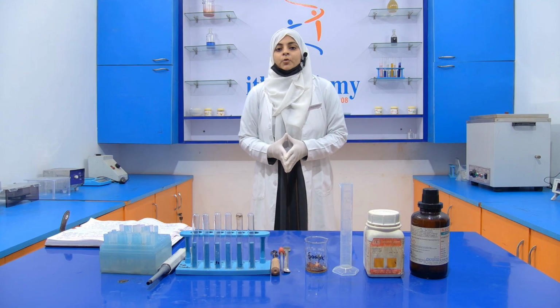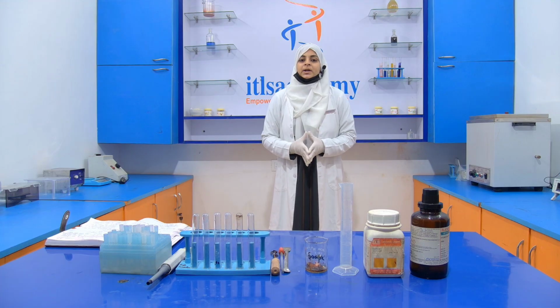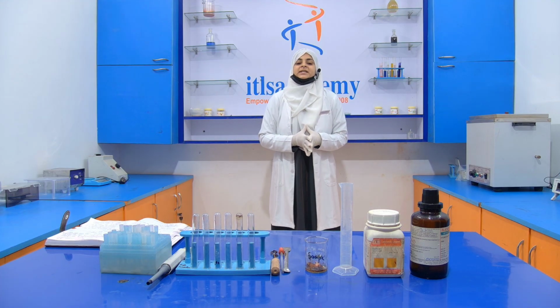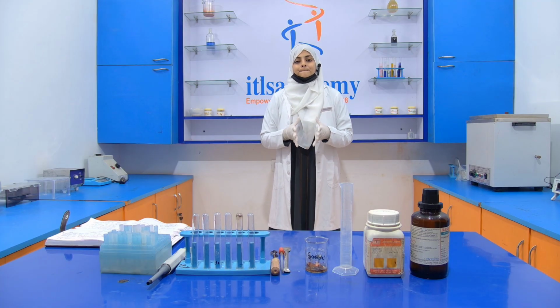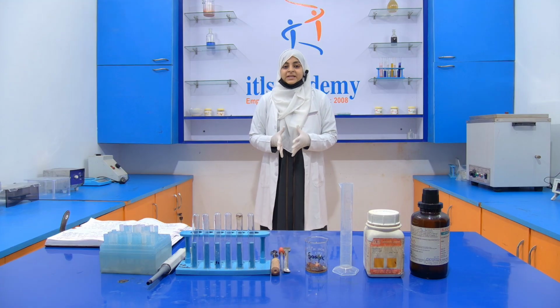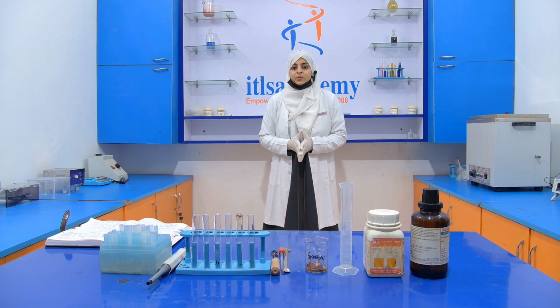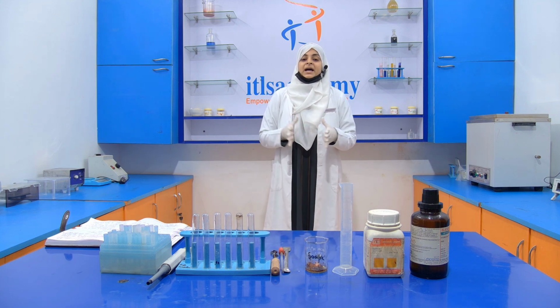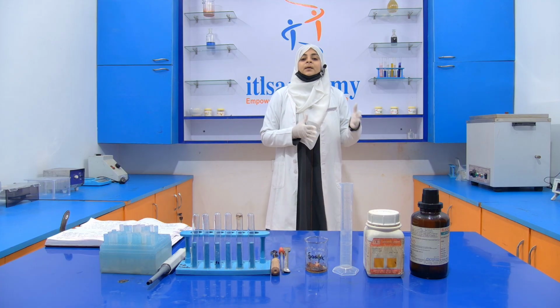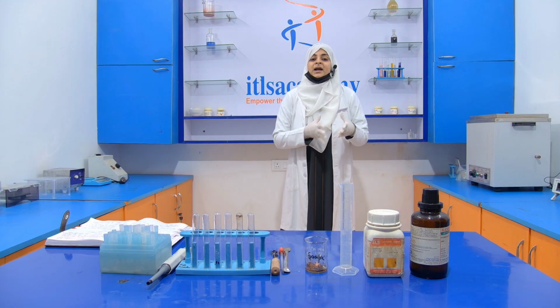Today we are going to perform another experiment of the series, that is the detection of Vanaspati or hydrogenated fat in milk. So what is this Vanaspati? Why is Vanaspati or hydrogenated fat added into milk? The reason behind the addition of Vanaspati or hydrogenated fat into milk is only that it is cheaper.